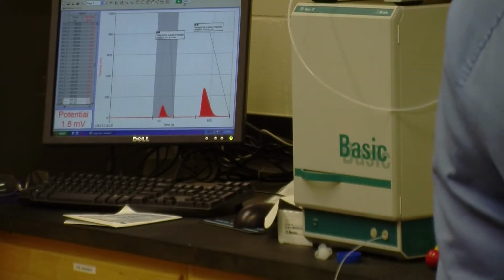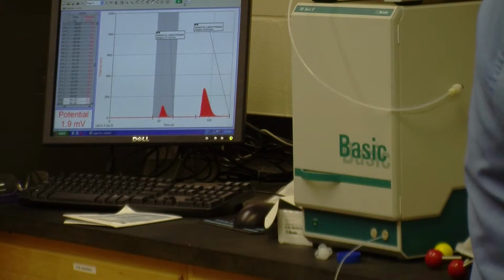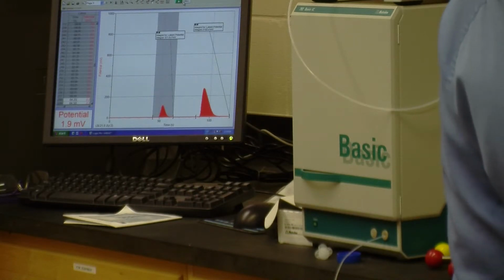Alright, so I'm going to sample this air, use this needle, and believe it or not, if I put it through the thick part of the balloon, it doesn't pop. I'm going to pull out a 1/2 milliliter sample, just like before. So now all those molecules have pushed their way in. Got a sample right here. Now we go to the injection port. And off we go.